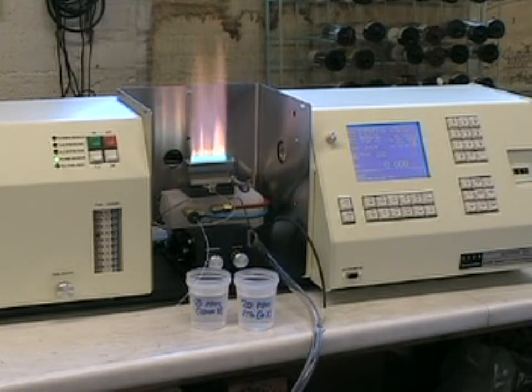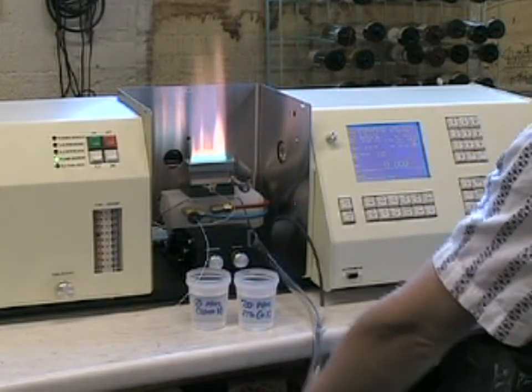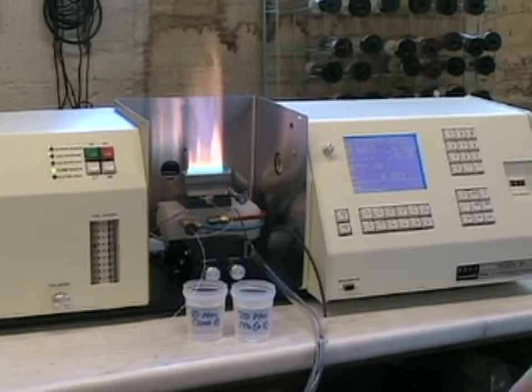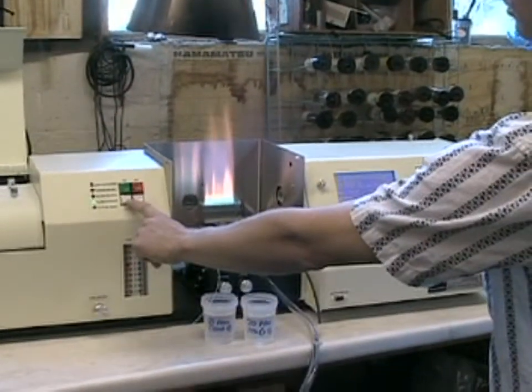The nitrous oxide burner head is a much more dynamic flame and requires very specific gas flows to ensure safe operation. The 211 will allow you to change over to nitrous oxide automatically once the air acetylene flame is lit by pressing the N2O or nitrous oxide button, which will automatically increase the fuel flow to make a very rich flame, and then change over to nitrous oxide, as we will now see.